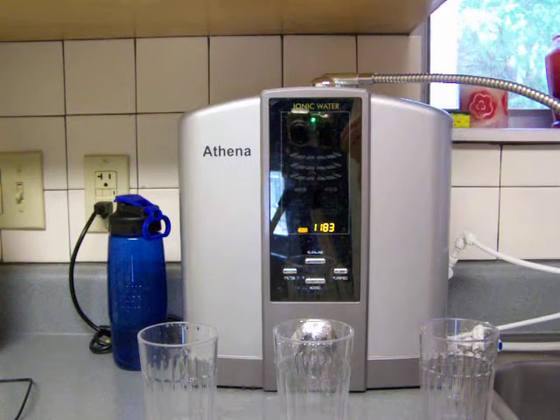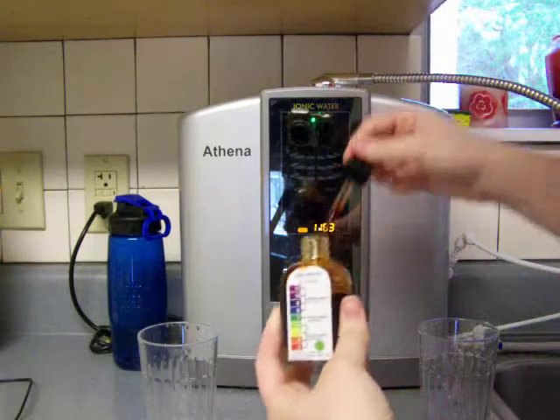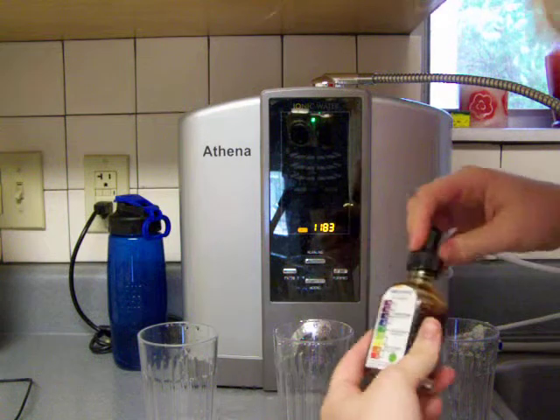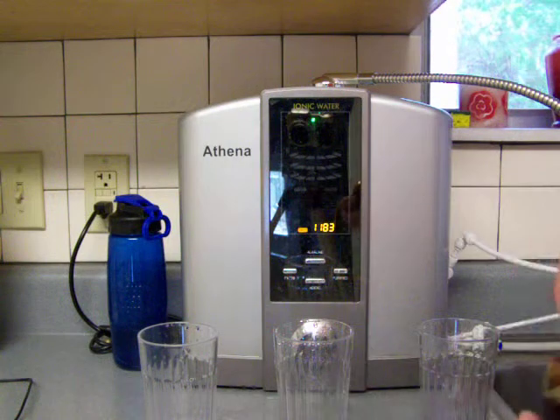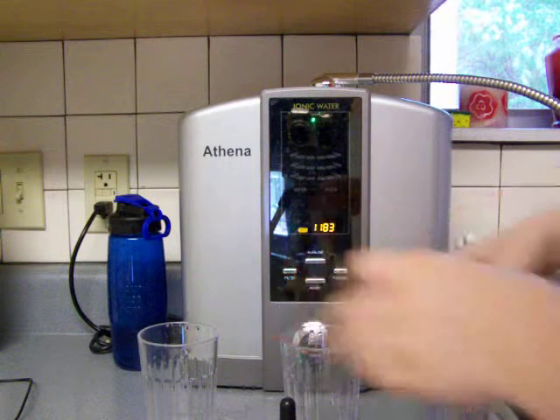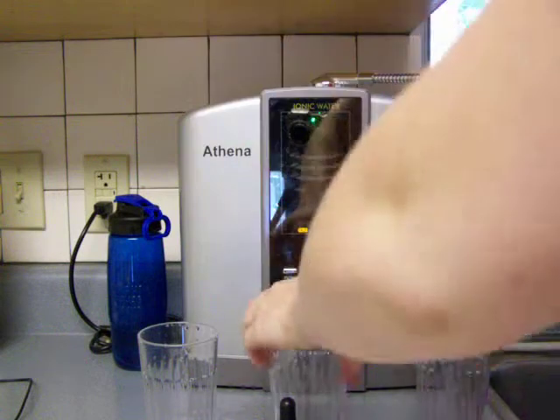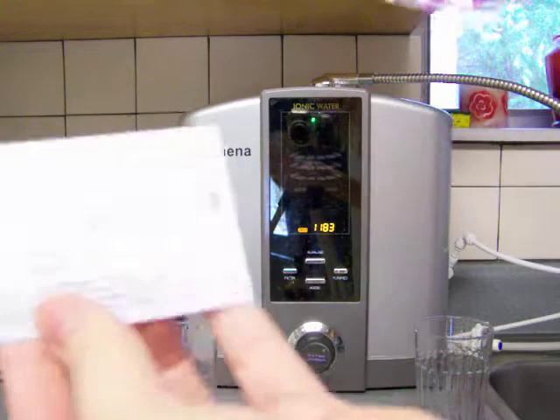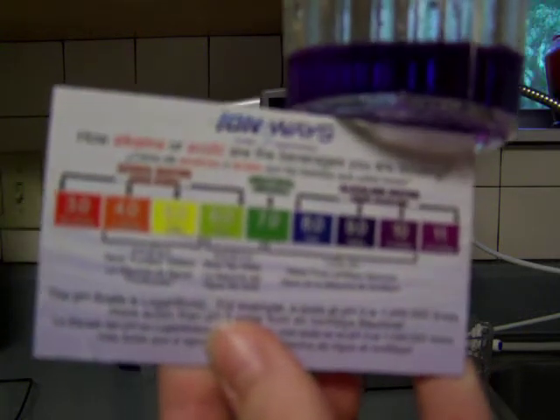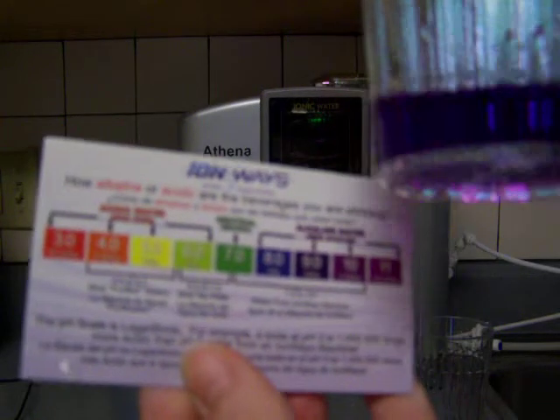This one has a color chart on the bottle and also one that came in the back — both of them are the same. Now this looks like a darker purple. It's very similar color if you want to look, but this one is darker from the bigger bottle. So using our chart here, that looks like a 9 because it's a really dark purple.